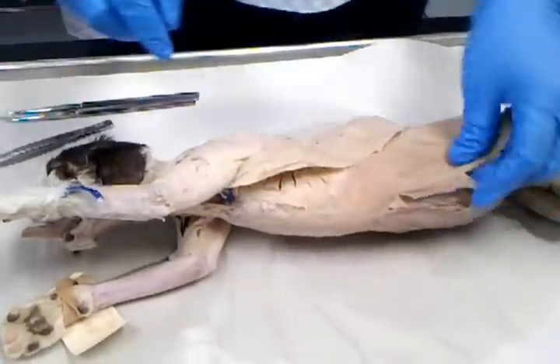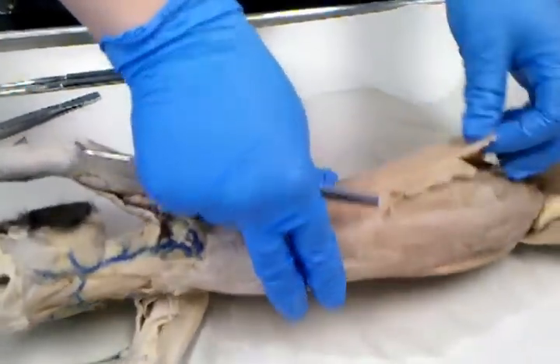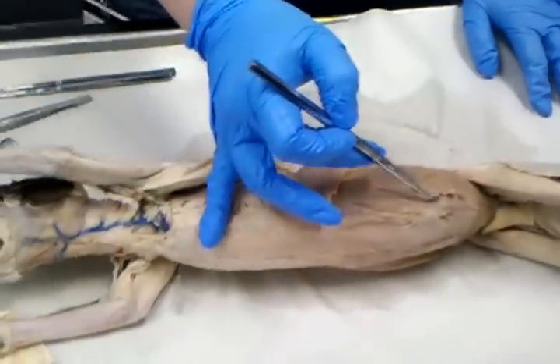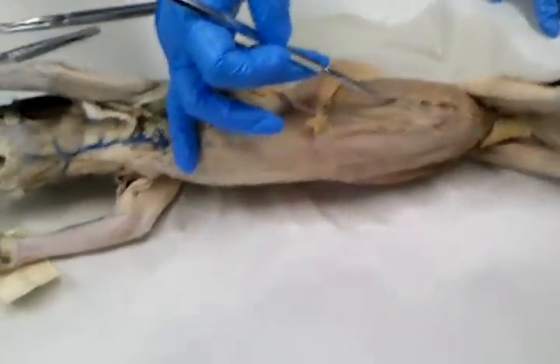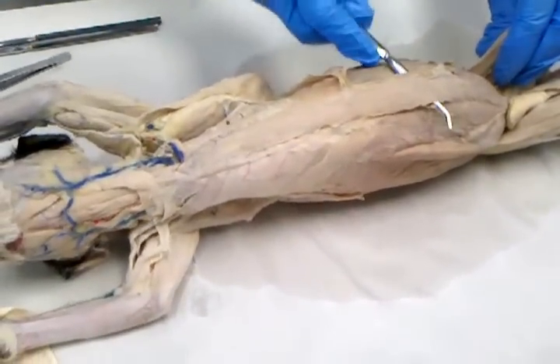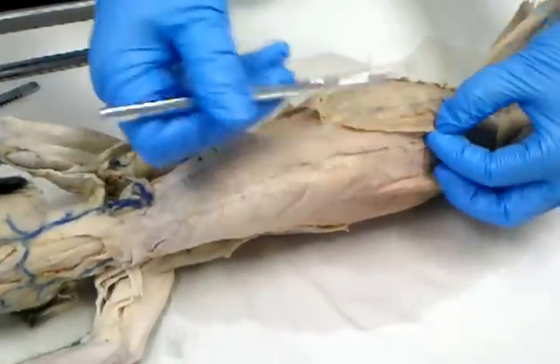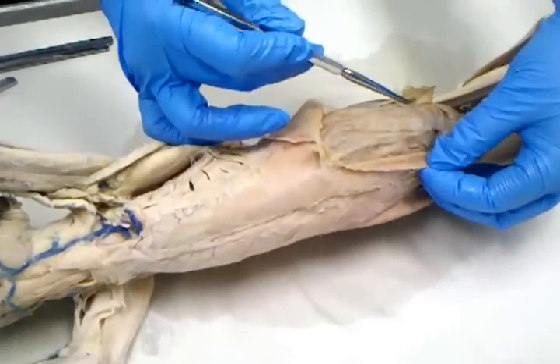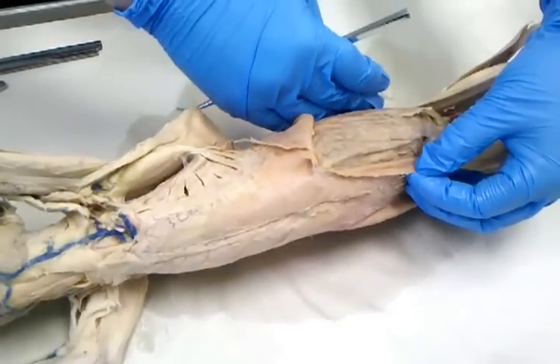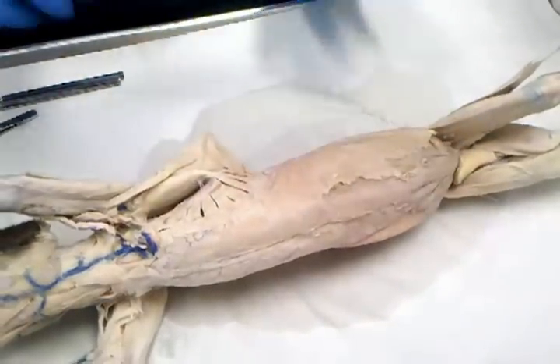There are four abdominal muscles you have to know. One superficial, the other three are deep. Superficial, you've got external abdominal oblique. When you flip it back, right here, I've peeled up the edge of the internal abdominal oblique. In the midline of the body, you've got rectus abdominis. Underneath both of these, if I flip back rectus abdominis and the internal oblique, you've got transverse abdominis, and it runs underneath both and all the way to the back. So four abdominal muscles.